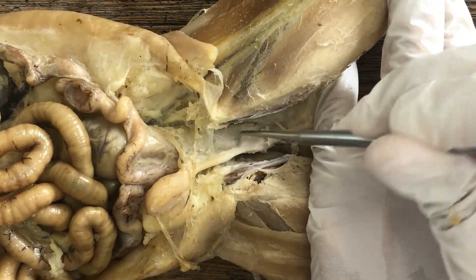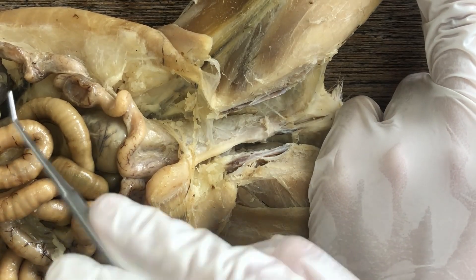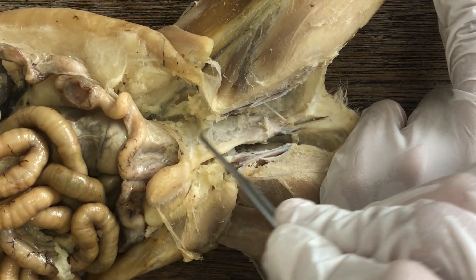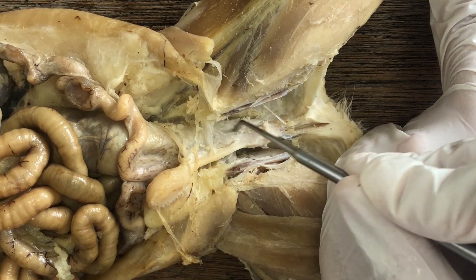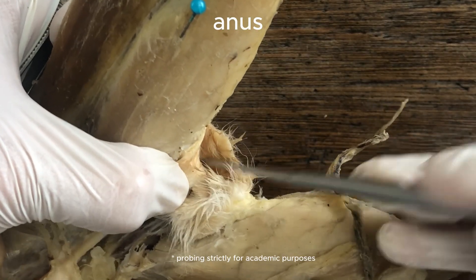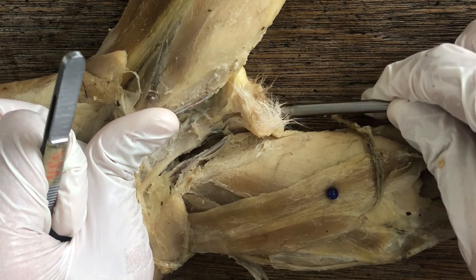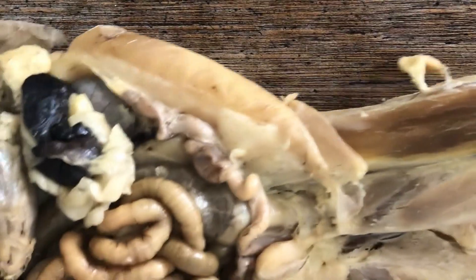Here is the distal-most segment of the digestive tract, which we postponed identifying during the digestive system dissection because it's located deep in the pelvic cavity. The colon continues in the pelvic cavity as the rectum. On the back side of the urogenital system is the rectum, which has a separate opening via the anus. More anteriorly is the urogenital sinus and more dorsoposteriorly is the anus connected to the rectum.